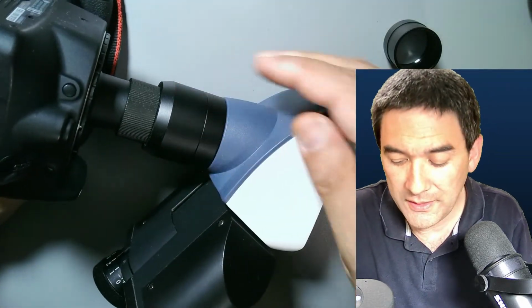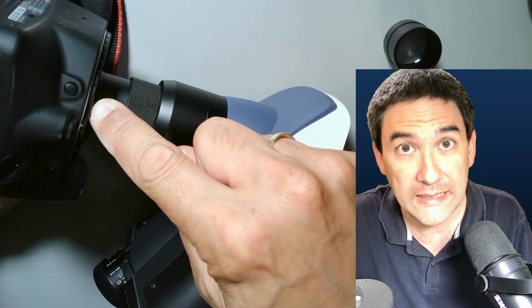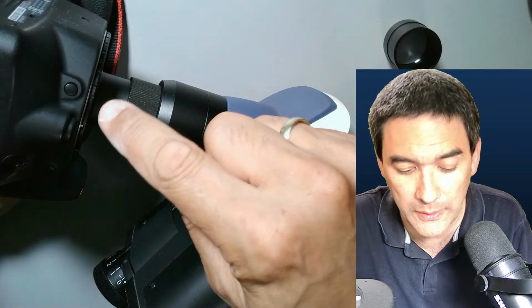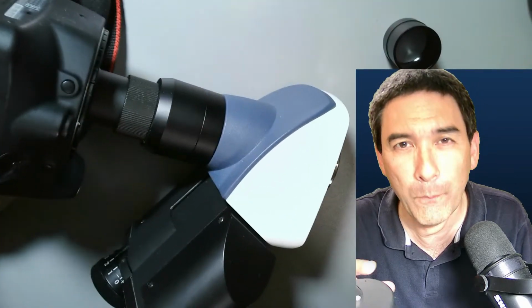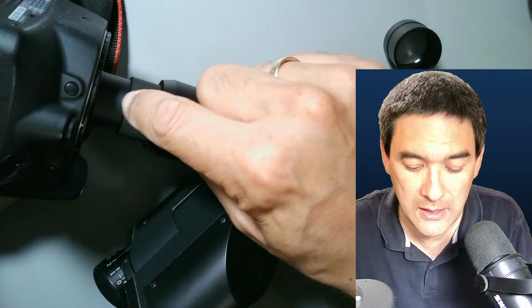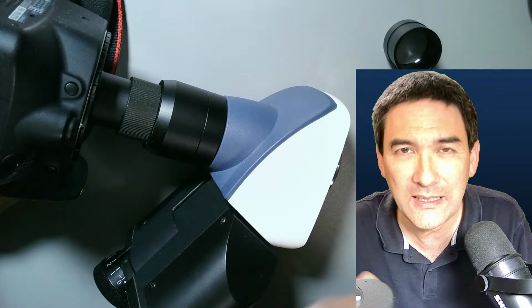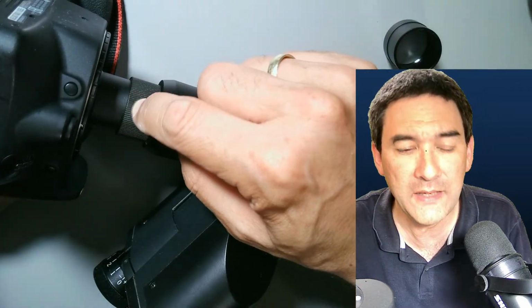And what will happen now is that the image is directly projected into the sensor. And it kind of works. I say kind of because there are a few disadvantages. And the thing is the following. You have to adjust the length of the tube in such a way that the image is in focus in the camera and also through the eyepieces, or at least more or less in focus. You don't want to turn the focus knob too much to find the focus. And it kind of is in focus, kind of, okay? I was a little bit off with the 4x objective, but it was slightly blurry. I had to turn it a little bit to get it into focus, but that was fine. Okay, with the higher magnifications, it worked fine.